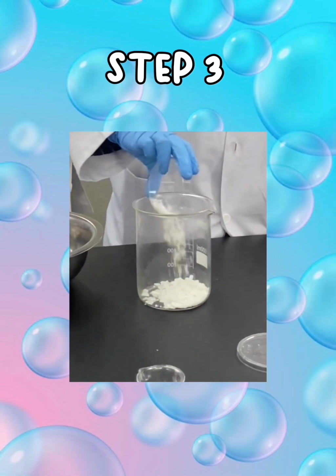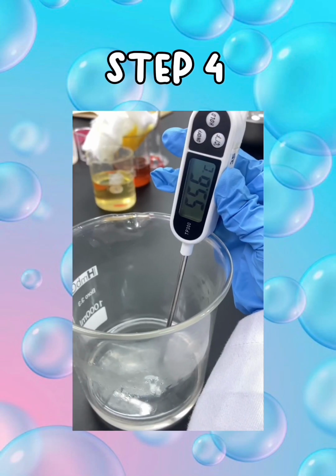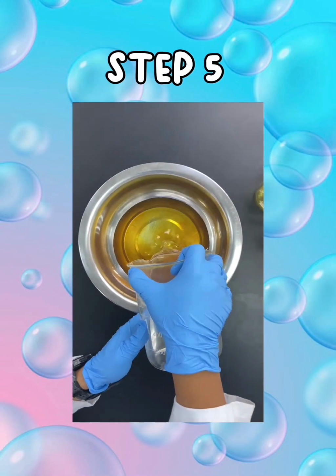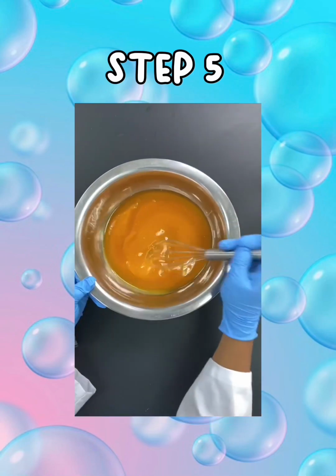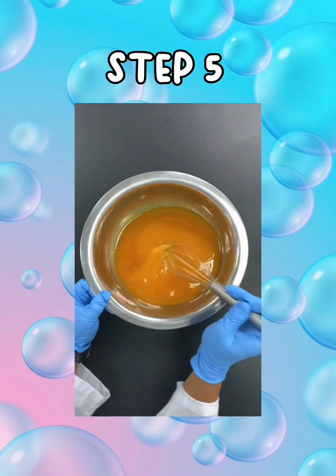Add 50 grams of sodium hydroxide and mix it with 100 ml of water. And then we measure the temperature and allow it to cool down to 60 degrees Celsius. After cooling, we added the sodium hydroxide solution to the oil and mixed it with constant stirring for 30 minutes until it reached a thick and creamy consistency.